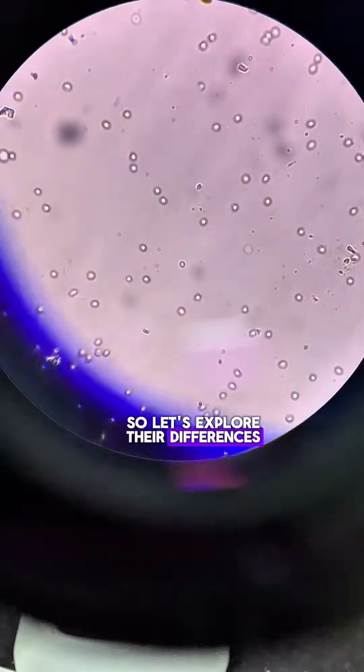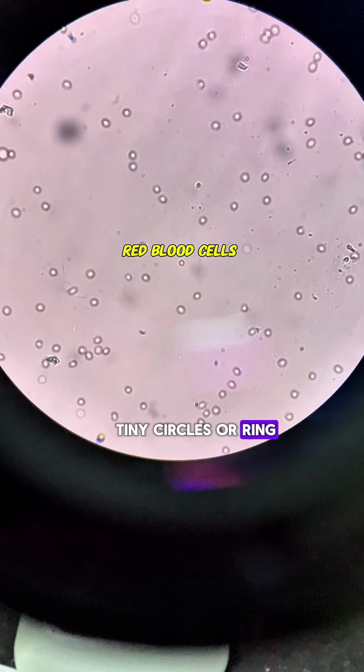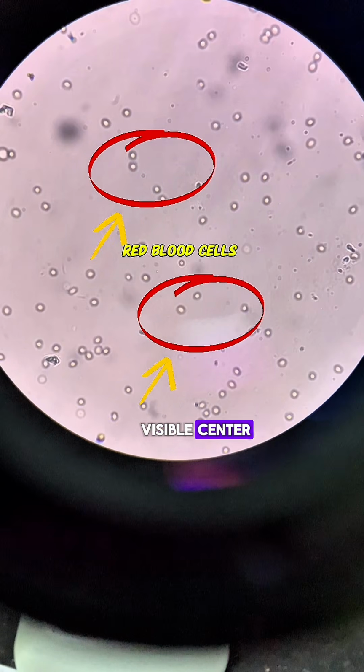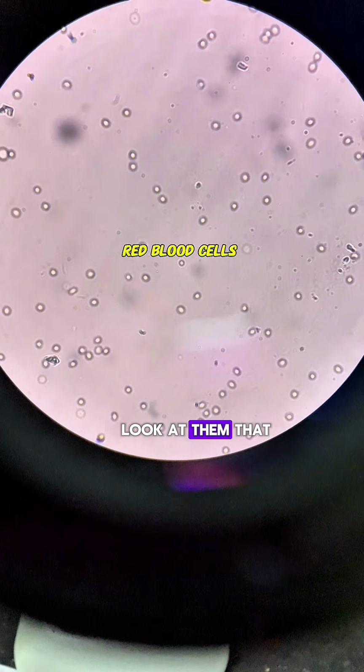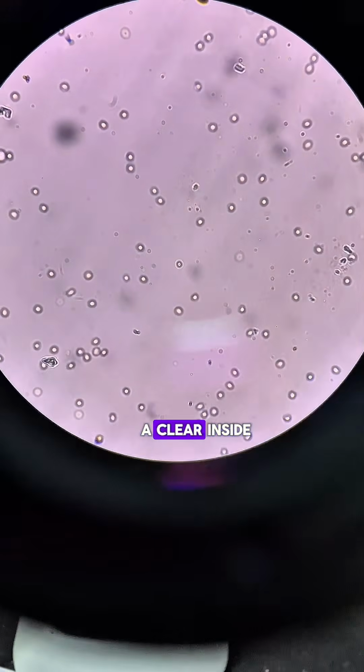Red blood cells are smaller, smooth, and look like tiny circles or rings. They don't have a visible center. That is, if you look at them, the inside of the circle is very, very clear. So it's like a ring with a clear inside.